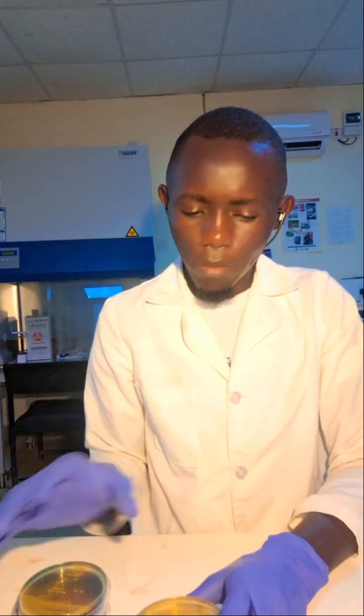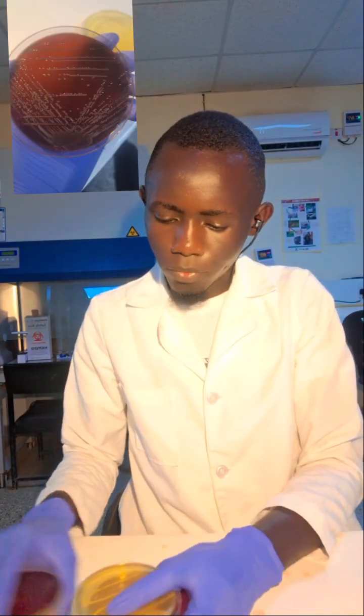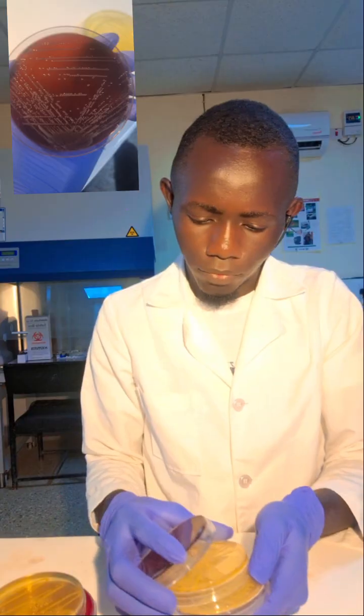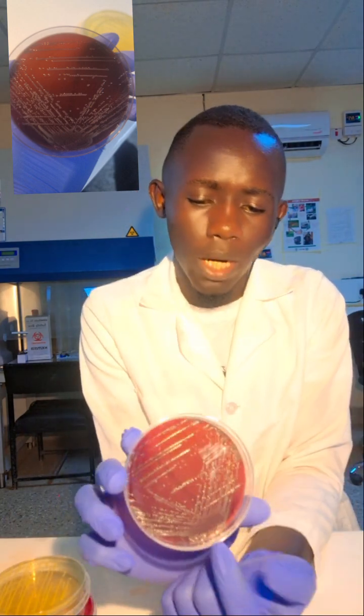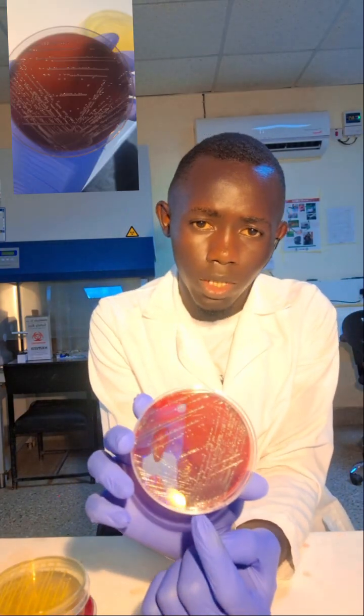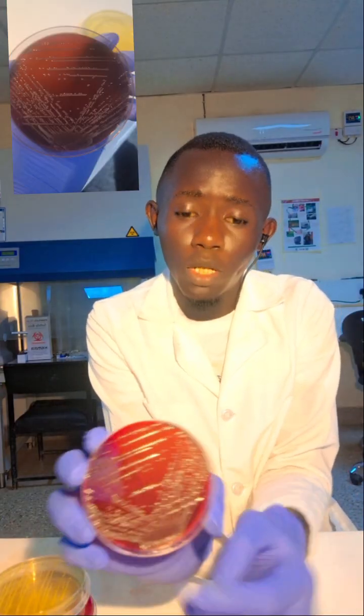So the other method is the radiant method. I'm going to show you the radiant method. For the radiant method, I just place the colony at one edge point. The colony is just placed at one edge point here, and you can see this one at this point. Then the lines are made vertically. You make the line vertically. As you can see, the vertical lines are running from the point of origin here.